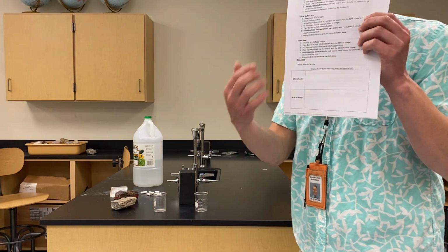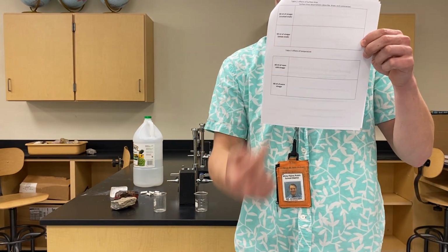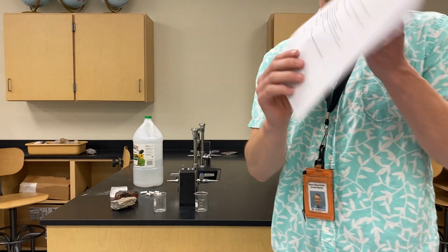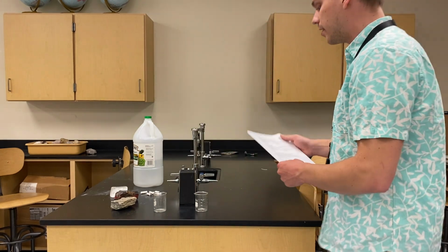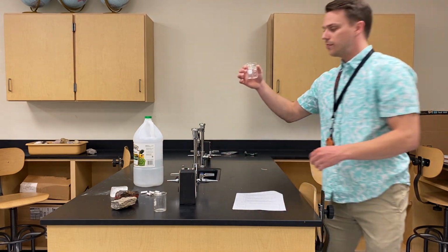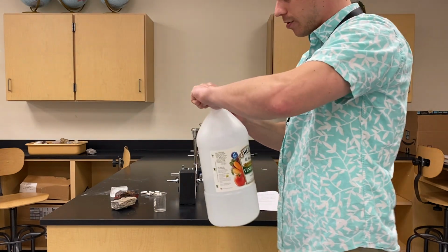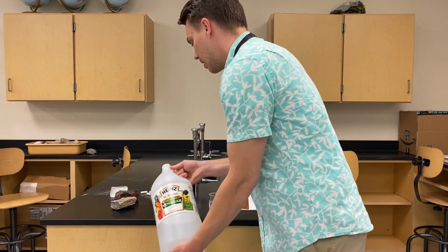Okay, so we're going to do test number 1. So test number 1 is this initial box. The next tests are on the next page, right? So this next test and then this next test. But we'll focus on the vinegar and water part of the lab. So I'm just going to fill that with a little bit of water. Water is going to be on the right side, and vinegar, or the acid, is going to be on the left.